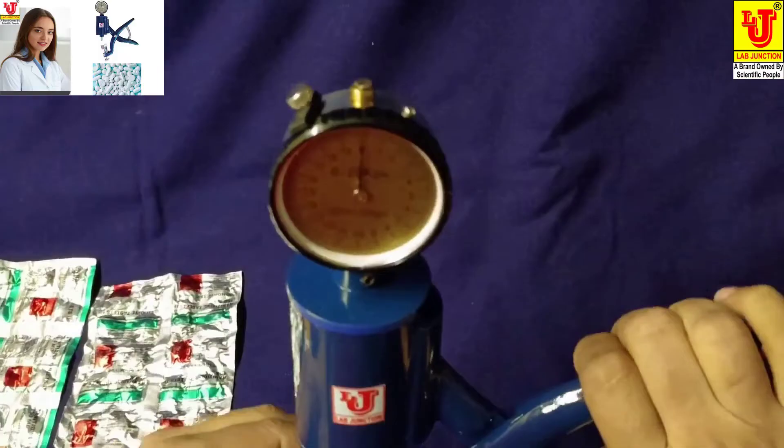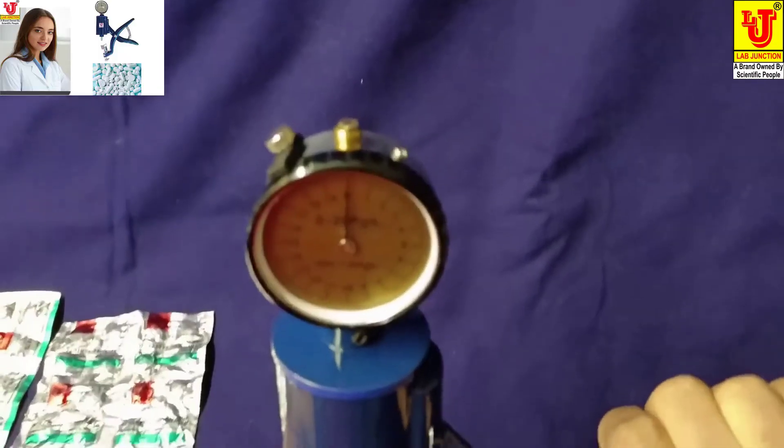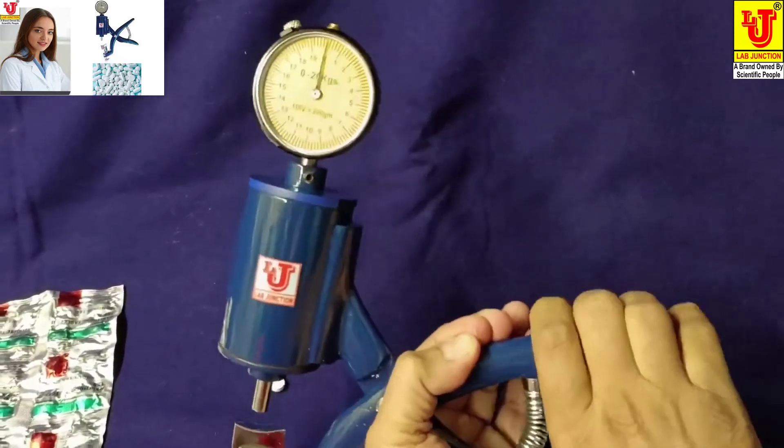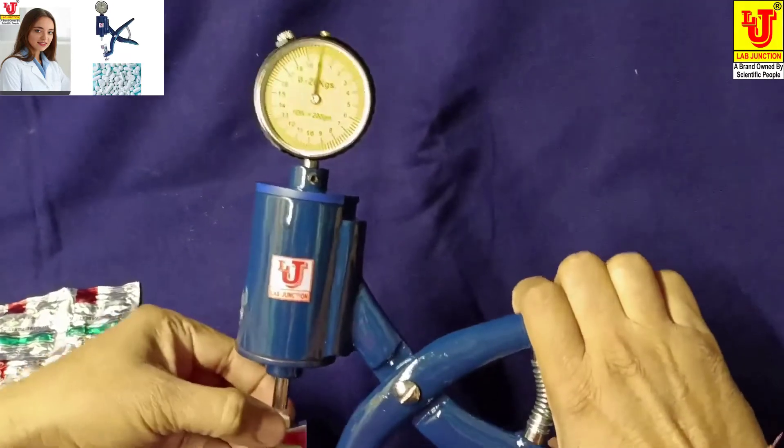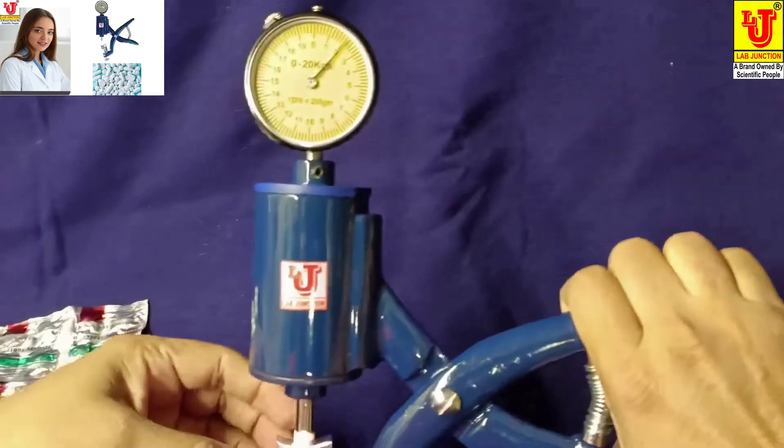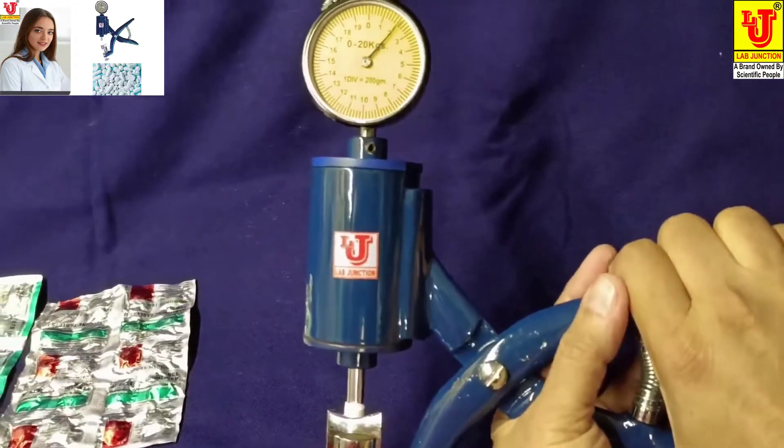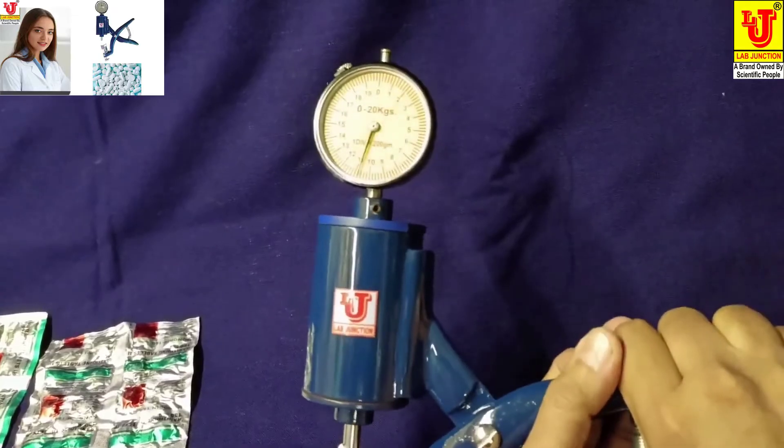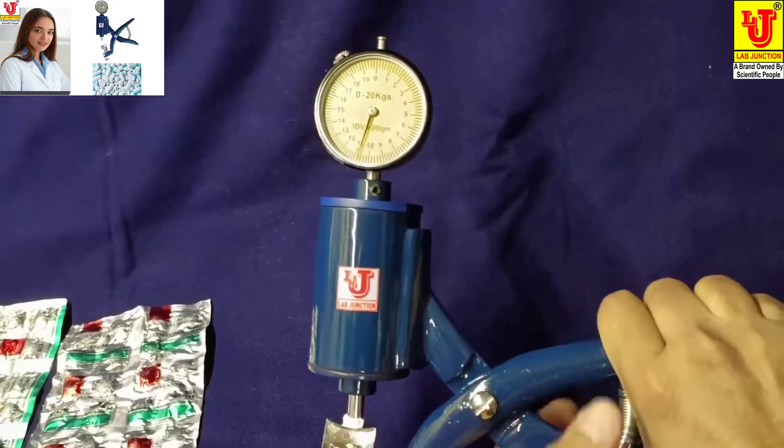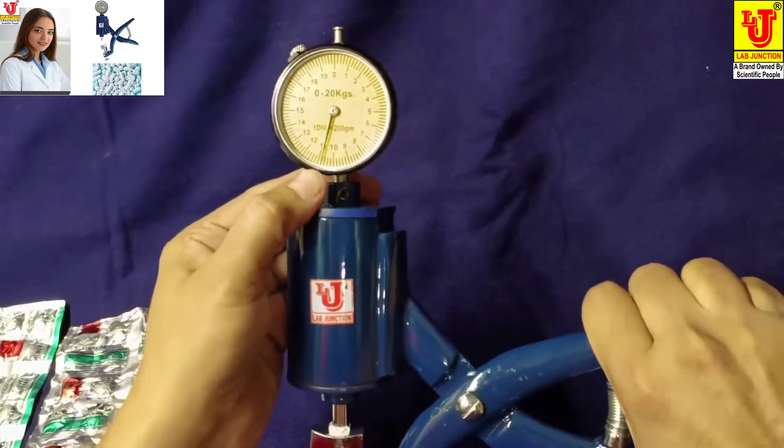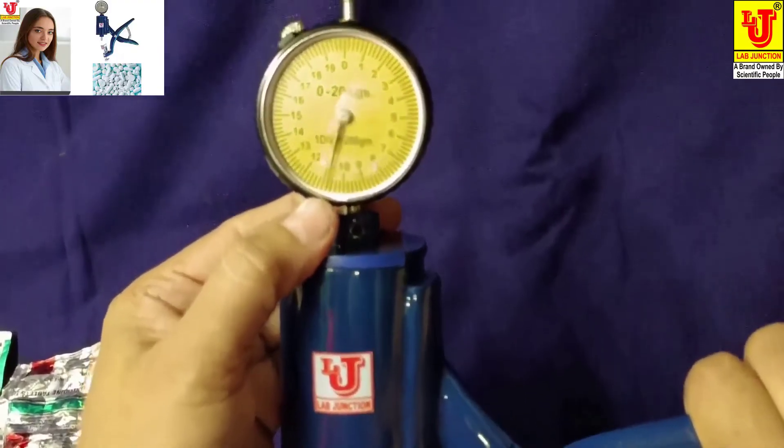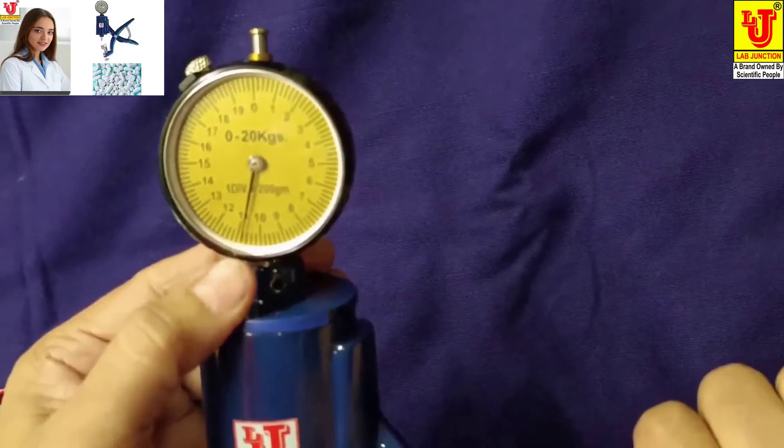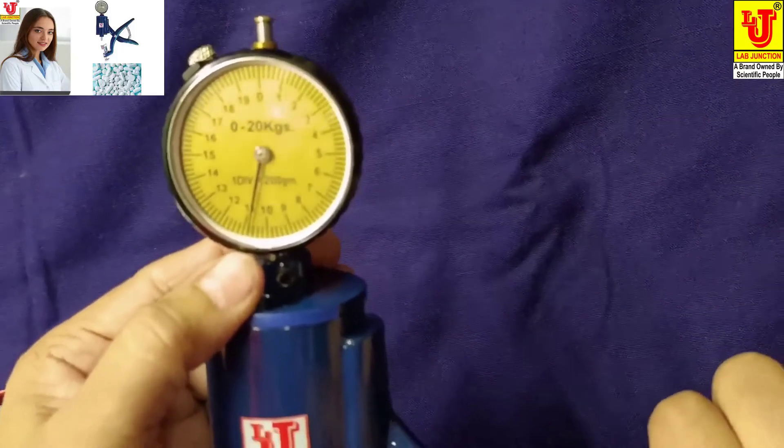Place the tablet on this part and apply force to the instrument like this. Now check the scale - the force to break this tablet is 10.9 kg.